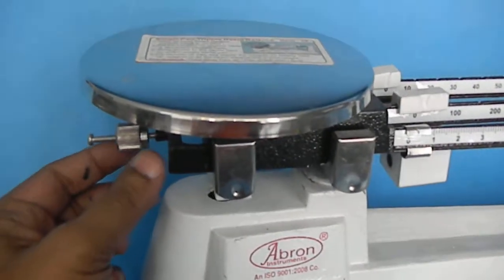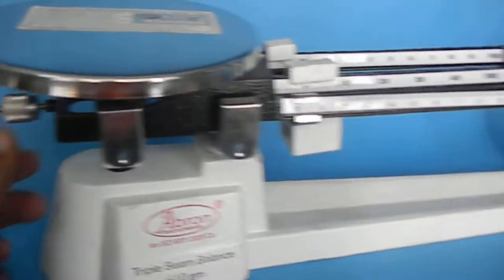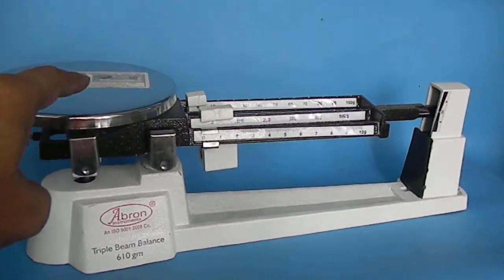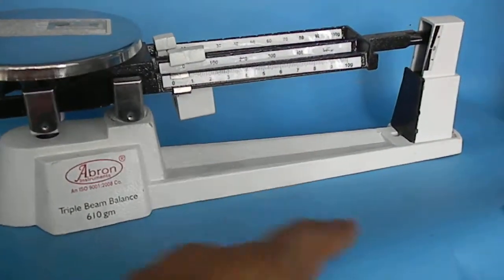What you can do, you can change this weight and put it on the center. Now this is set. If you put any weight, it gives you the weight. When you move it, it gives you the weight total of them.